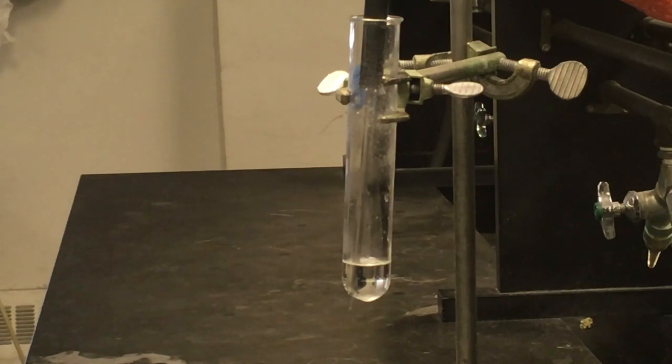Our unknown compound, if you're going to look it up, is benzophenone. So you can actually look up its molar mass in advance to see how accurate your results are going to be once you get your actual freezing point from this trial, and your freezing point depression constant determined from your results in part 2 of the experiment. Our goal here again is just to wait for our solution to solidify.